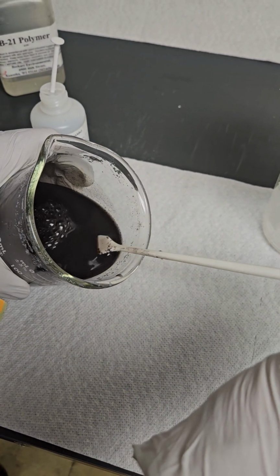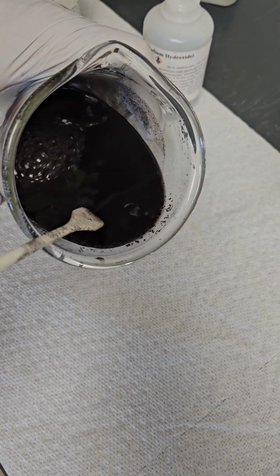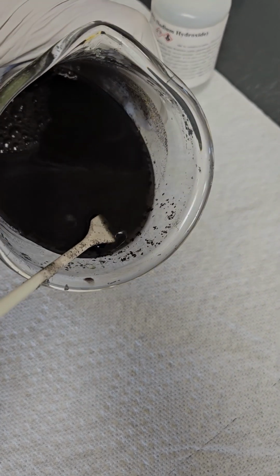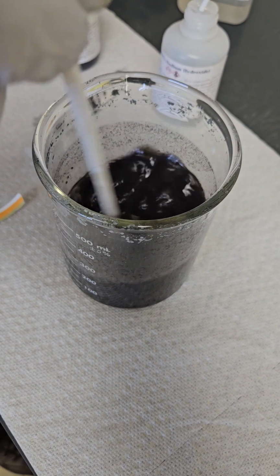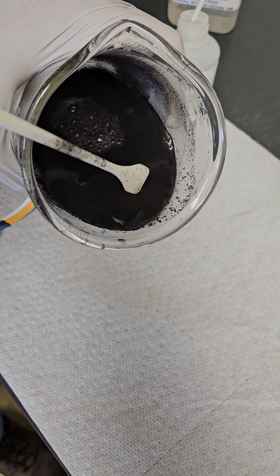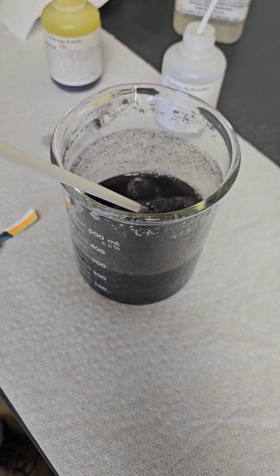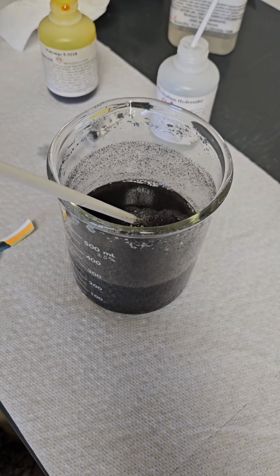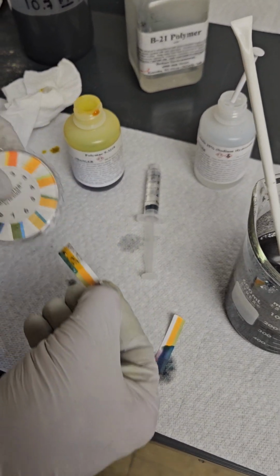And here's the break now. You can see the starch broke out. There's the flock. So that's kind of the flock I wanted to get right there. The pH after the coagulant dosage dropped down to about a 5.